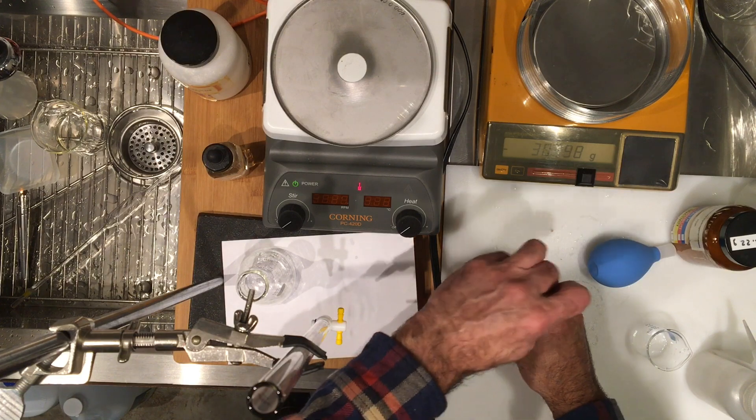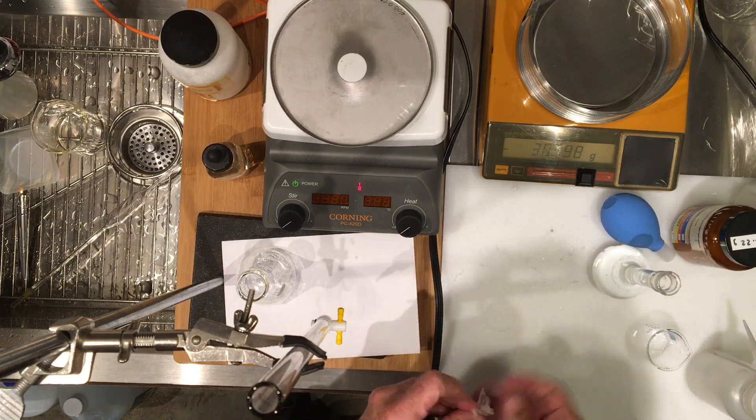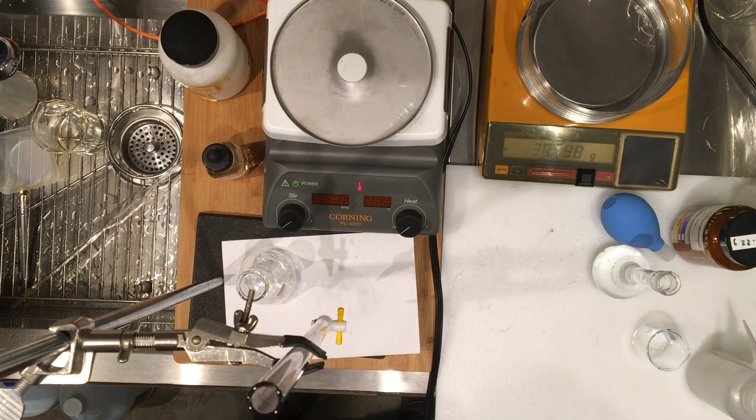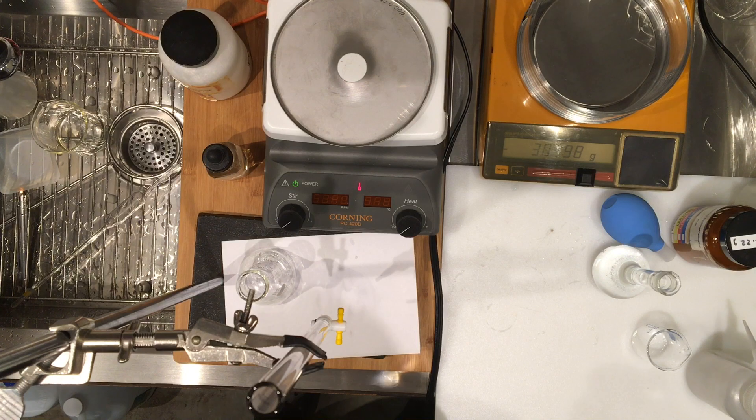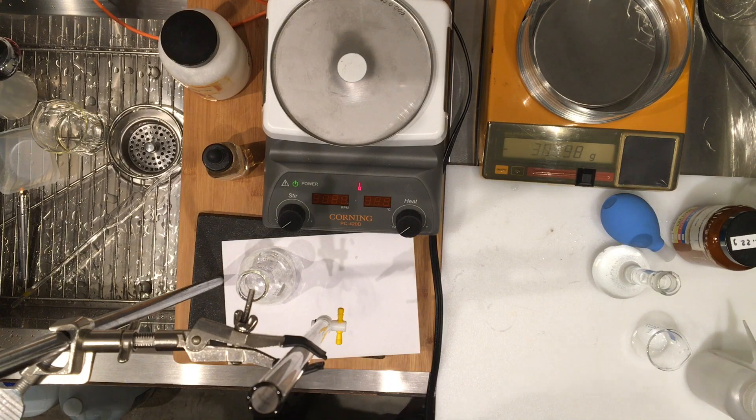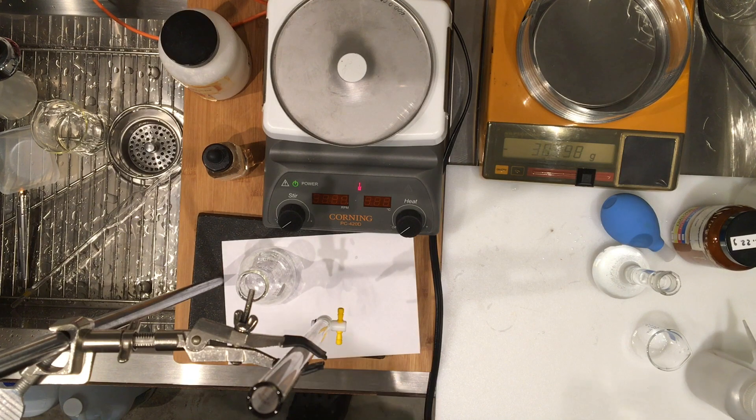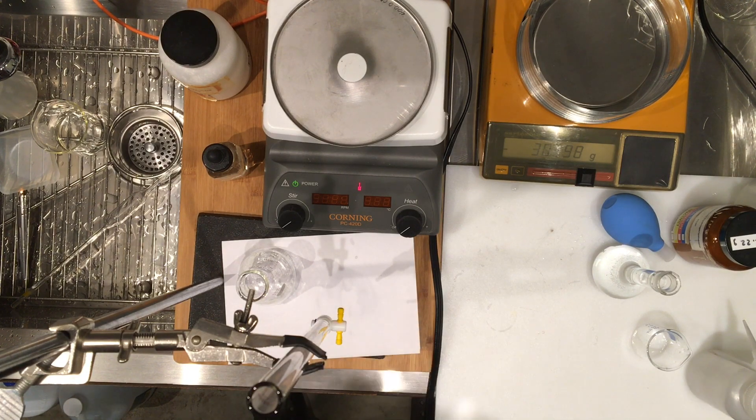And now I'm going to use this diluted vinegar and titrate that with my standardized sodium hydroxide and determine the concentration in molarity of this vinegar solution. So we have several titrations that we should normally do to get good precision for our work, so I'll show you those videos.